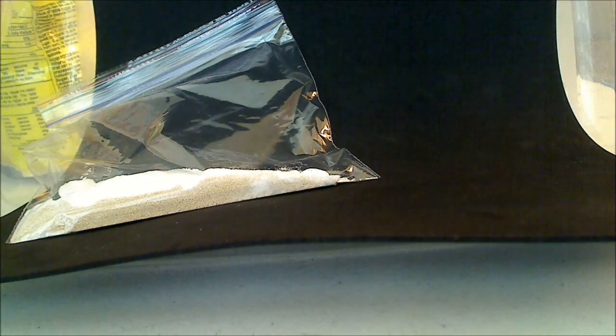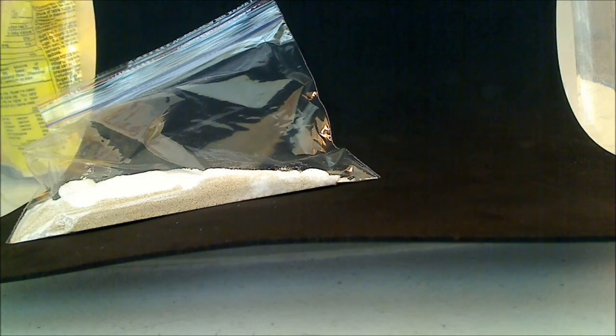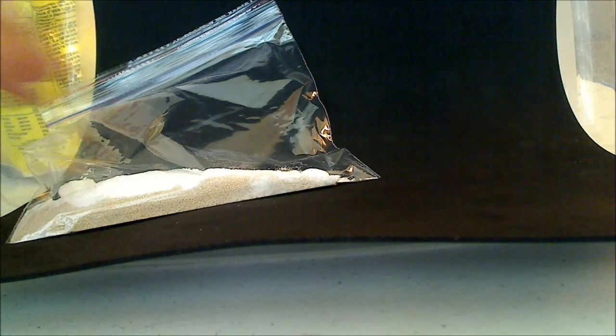Hello. I'm going to do a little demonstration of the fermentation of glucose using yeast.